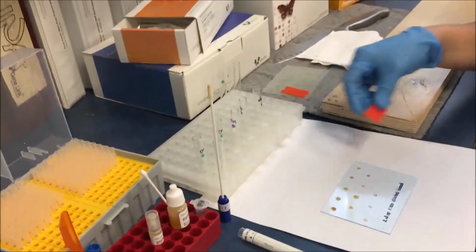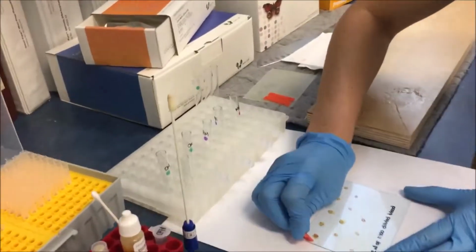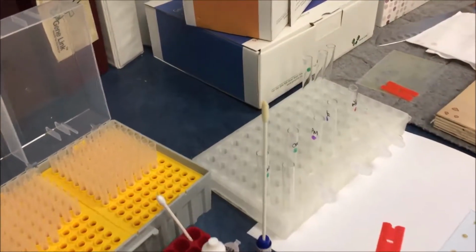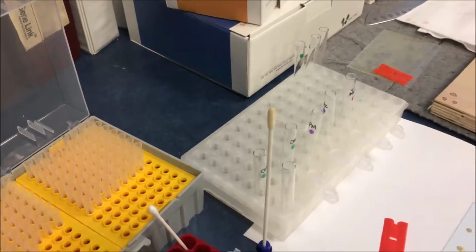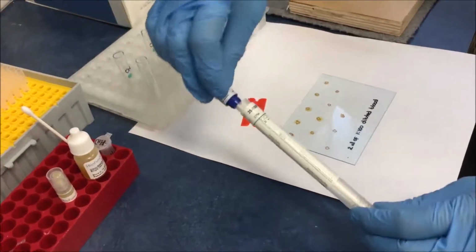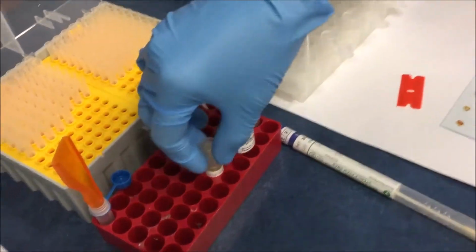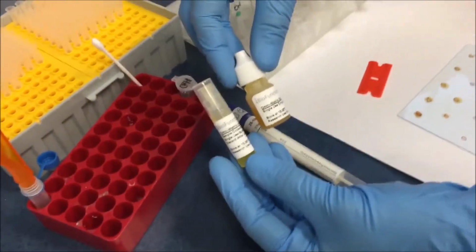Now we are going to compare with the new Omni-Matrix sample collection system. In the classical method, after the sample collected on the swab has totally dried, this swab is inserted into the container and transported to the lab, where it's going to be processed for DNA extraction. The Omni-Matrix is supplied, as in the previous session, in 2 tubes.